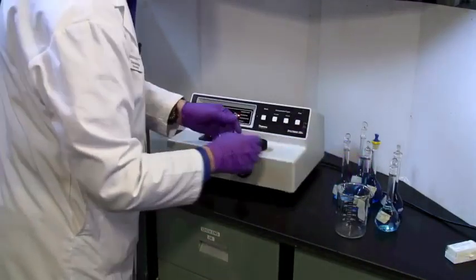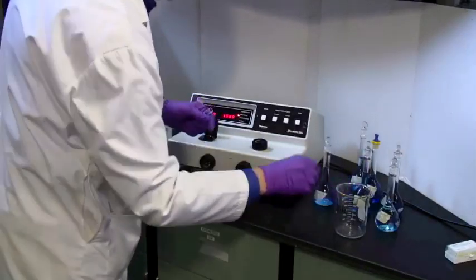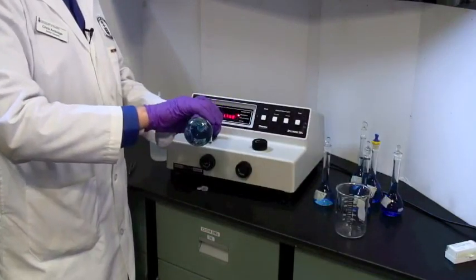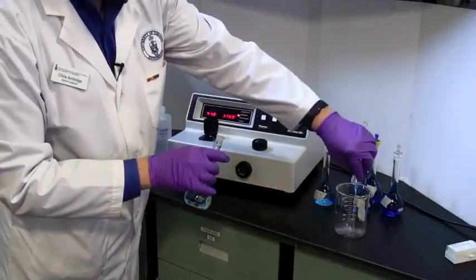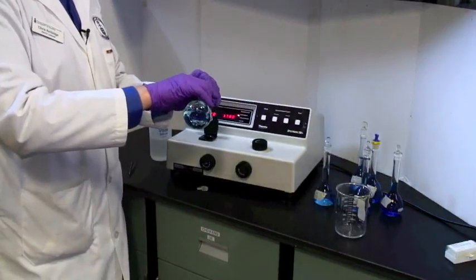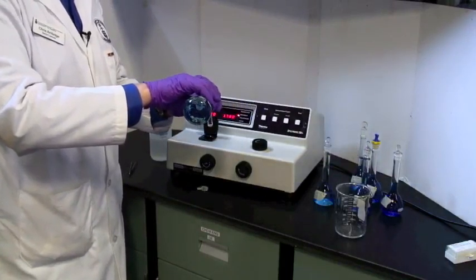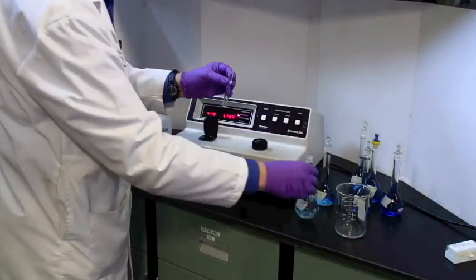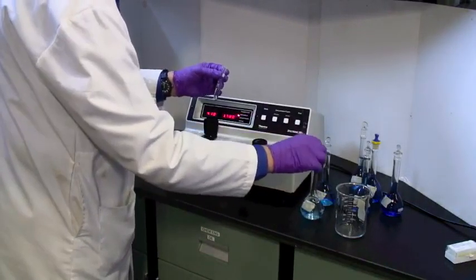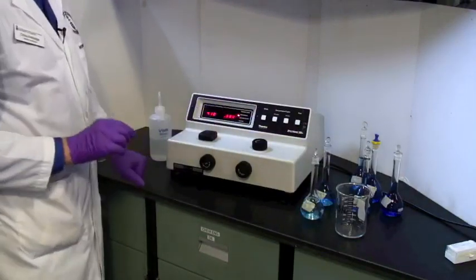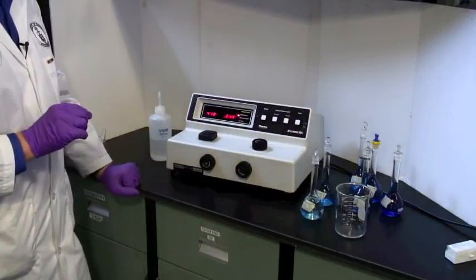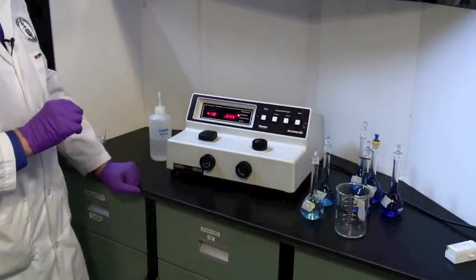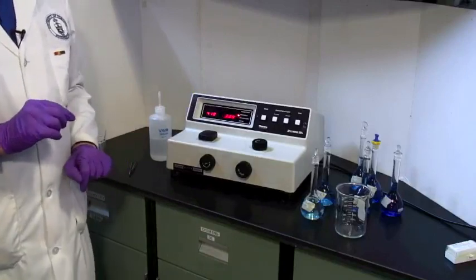At this point, dump the water, and take the first solution we have, and rinse the tube. You've got lots of solution usually, and then fill it. As long as you're up to the bottom of the disc, you'll be all right. Put the lid back on, and read. And so, my first sample, which is 1 times 10 to the minus fifth molar, has an absorbance of 0.009.